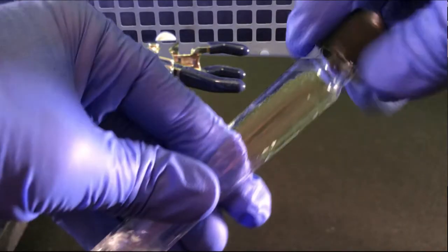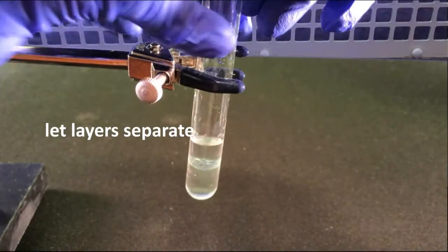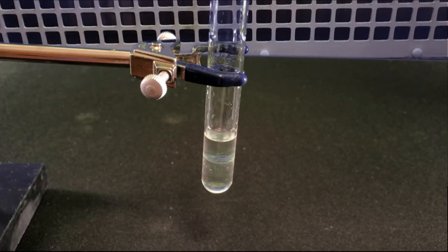Note that diethyl ether has a low boiling point. As you do these extractions and washes, there's a chance that some of the ether will evaporate. If the organic layer is significantly smaller than the aqueous, add a little more ether to the test tube.